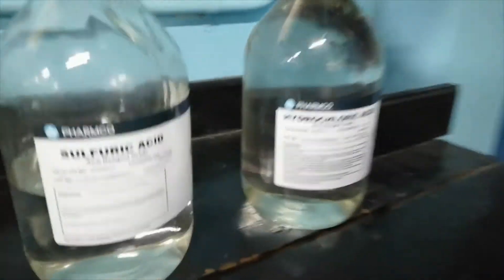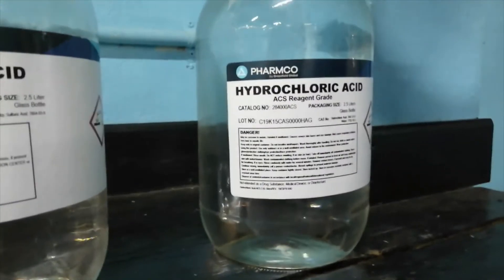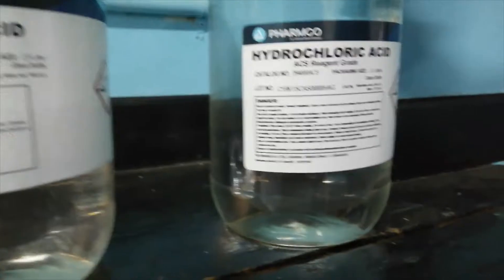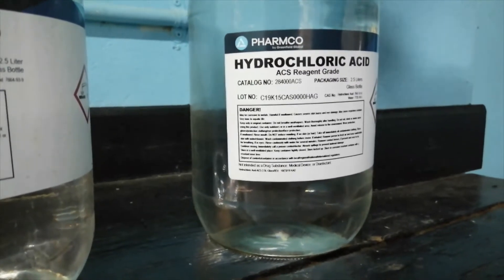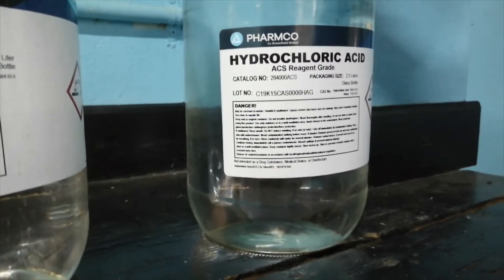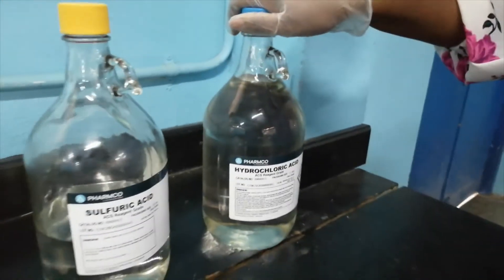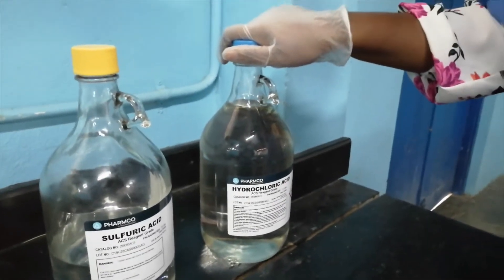Right here we have hydrochloric acid, and you know of course that this is found in the stomach of mammals. This industrial acid is made by dissolving the gas hydrogen chloride in water, creating hydrochloric acid. It's a monoprotic or monobasic acid.